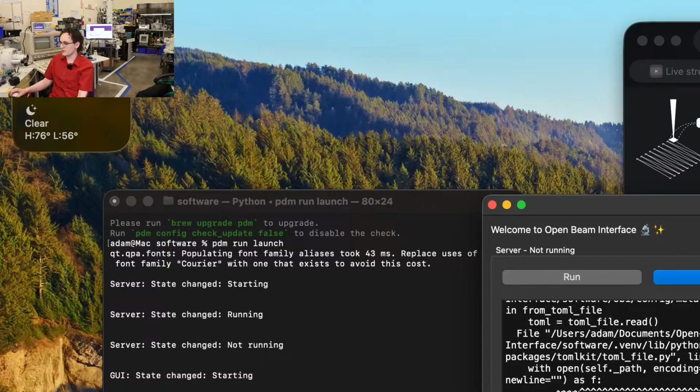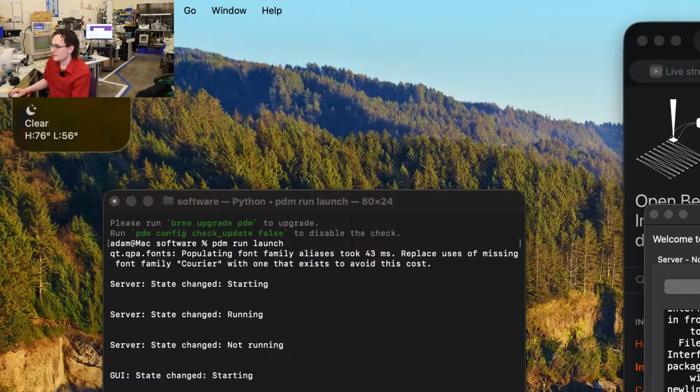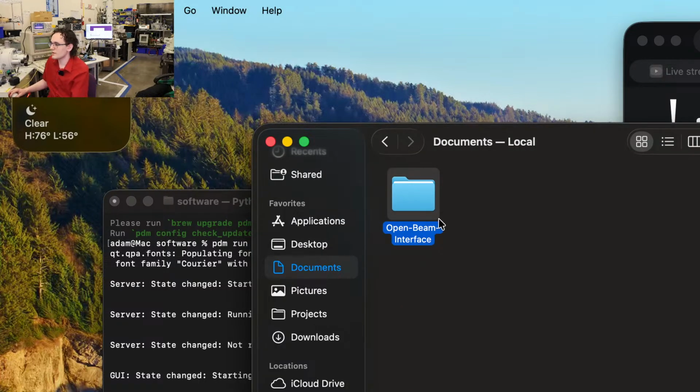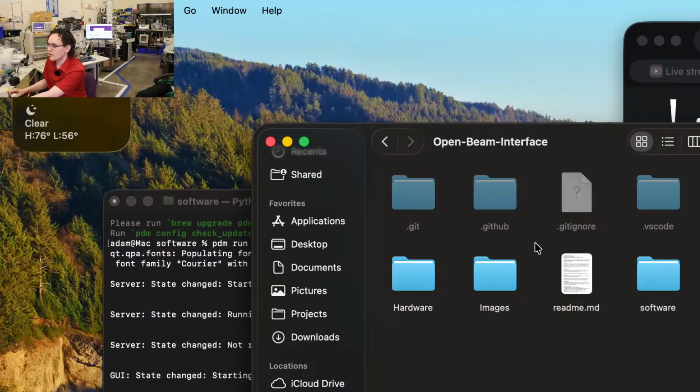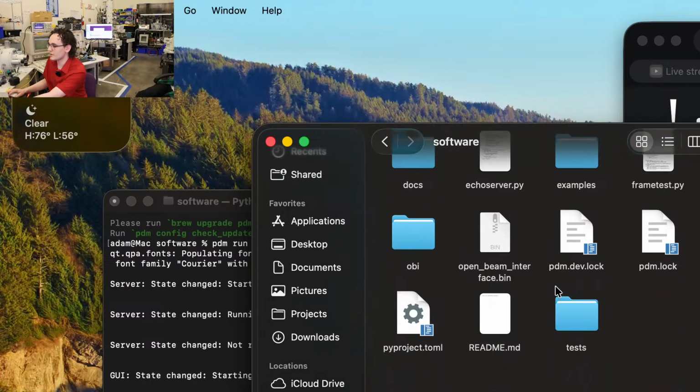Okay, and we do have an error right now. So we have no such file or directory microscope.toml. So what's going on there is every microscope can be a little bit different. So we are set up to have a configuration file to define how your microscope works.